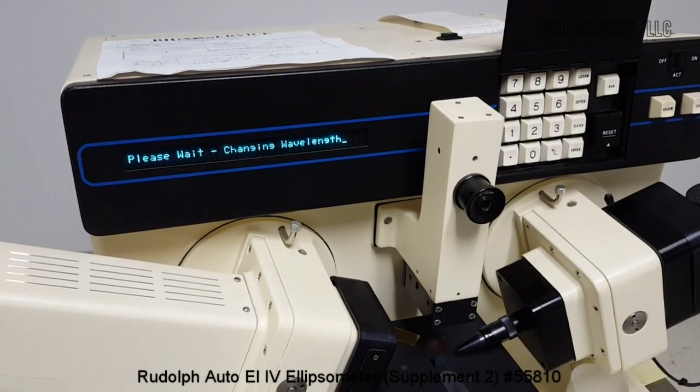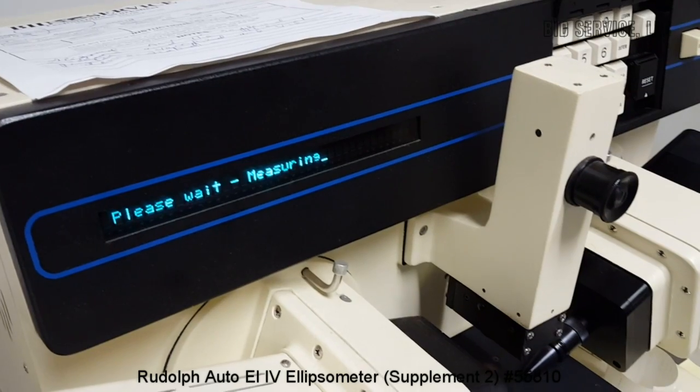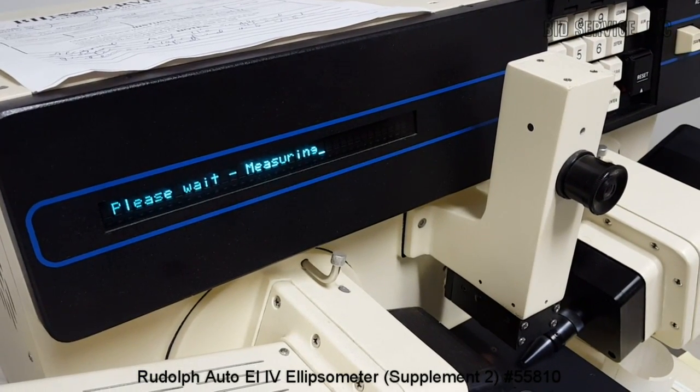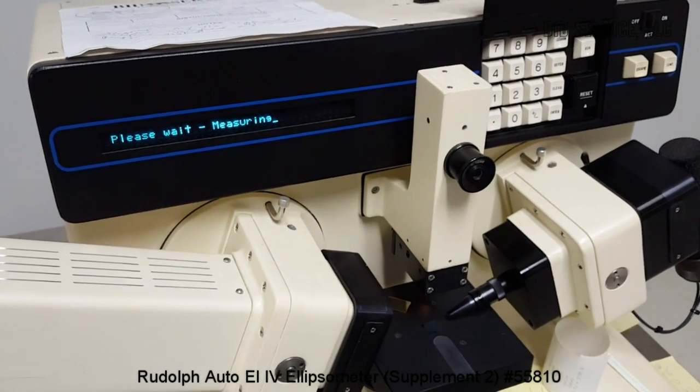So I'm attempting to compare the recipe parameter that I entered and the default parameters. Program 21 takes substrate to be as silicon.